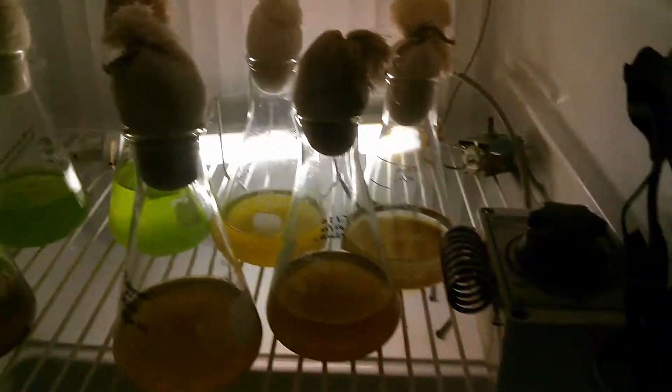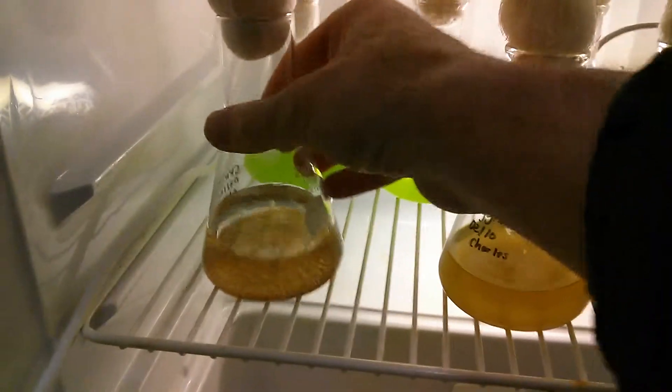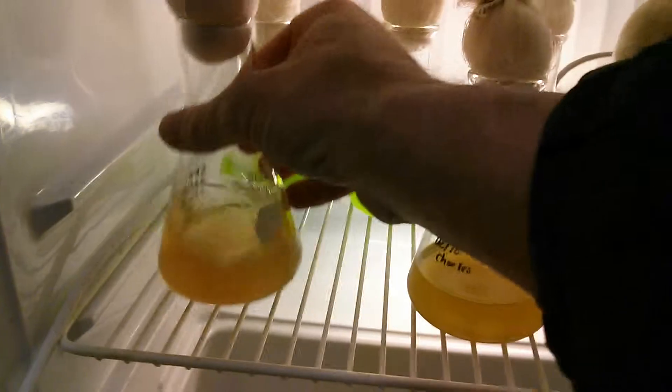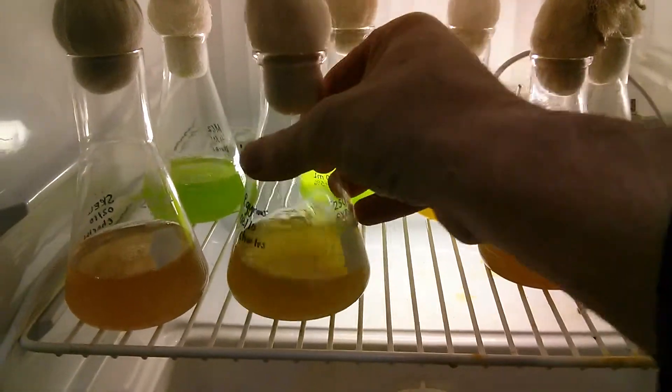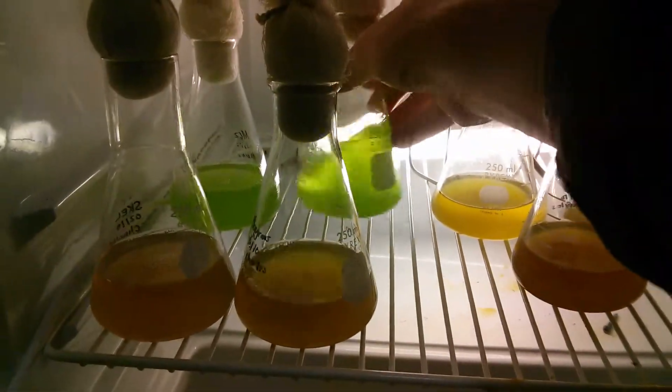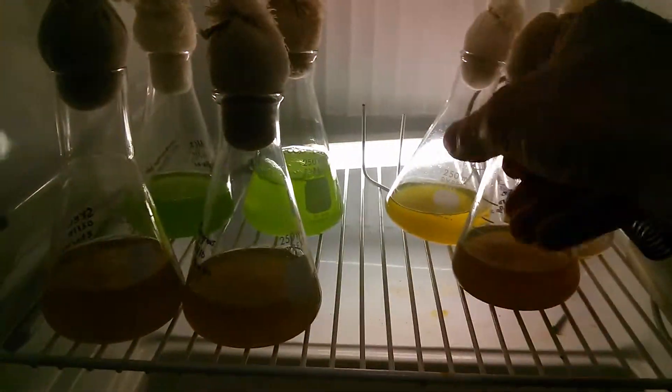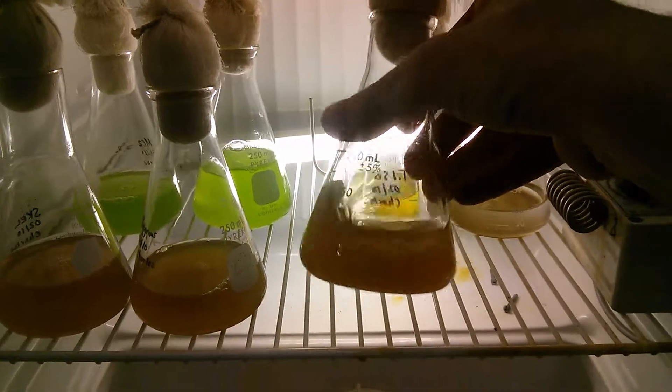Just an ordinary grow light that you would use for growing your plants in your little mini greenhouse every day. Three or four times a day is nice.